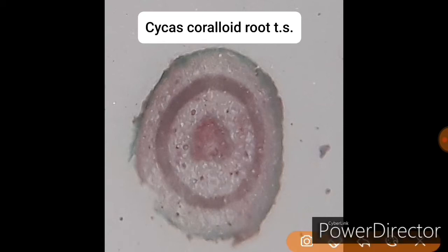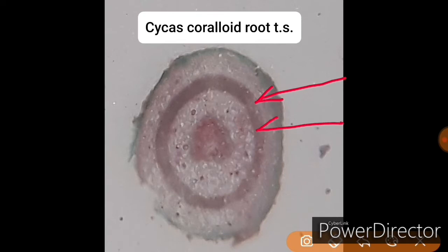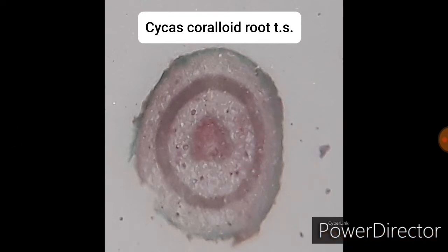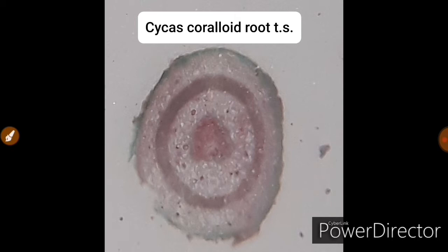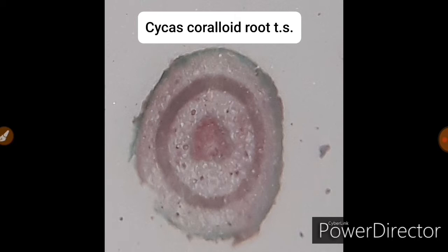This is the coralloid root transverse section viewed under a dissecting microscope. In this section you will be able to clearly see the three cortical regions — the outer cortex, the middle algal zone, and the inner cortex. The stelar portion, which is a triarch xylem, is not clearly visible in this section. It is placed under a dissecting microscope to observe the overall appearance of the coralloid root transverse section.